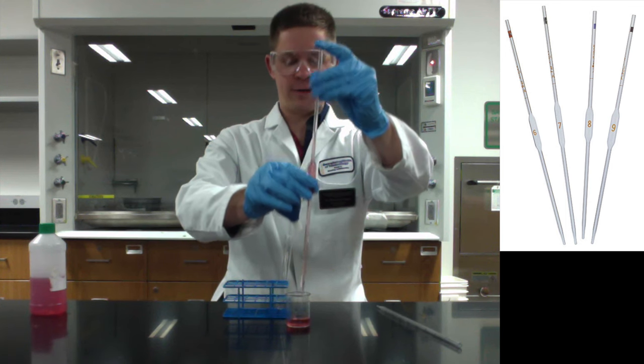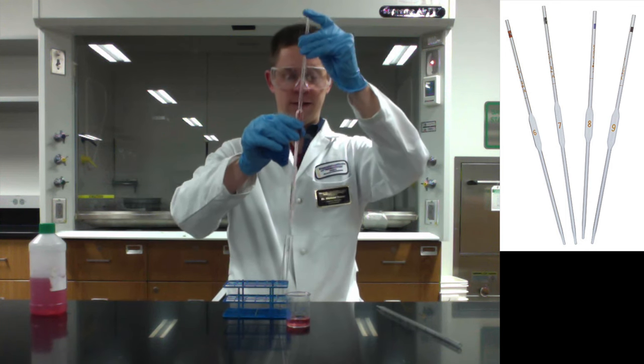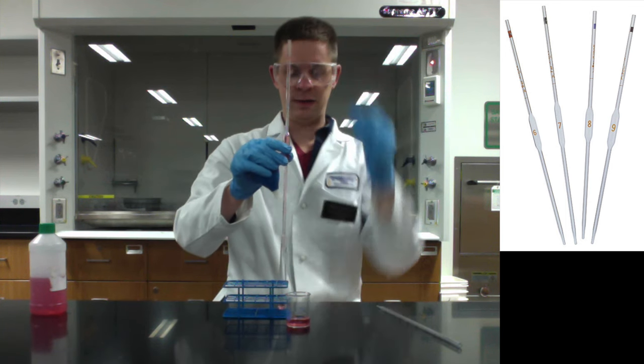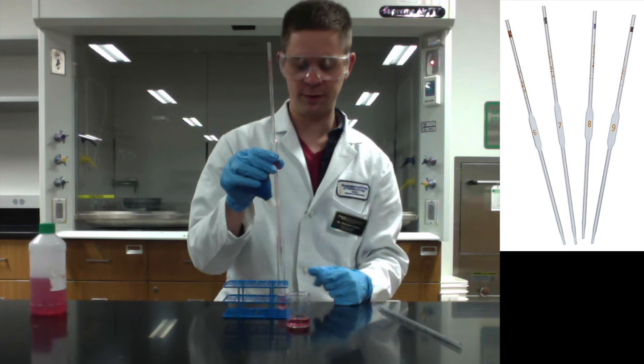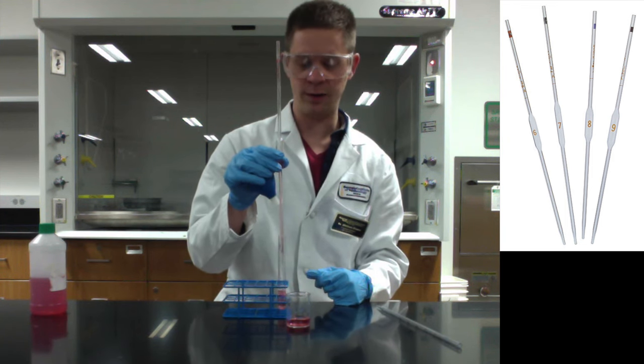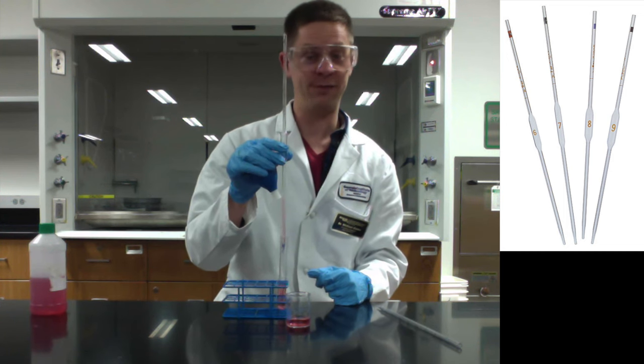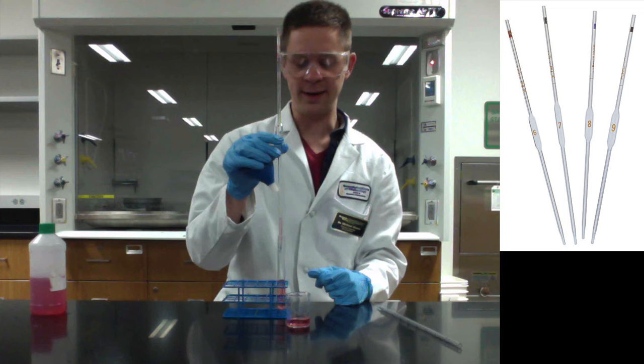So we've got the bottom of the meniscus right on the line now, and you can just go right over the test tube and simply let go. As this is filling, what you're going to notice when this is done filling is that there's some liquid left in the bottom of the pipette.